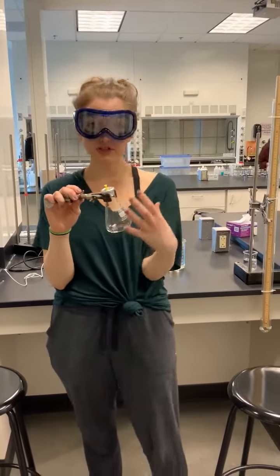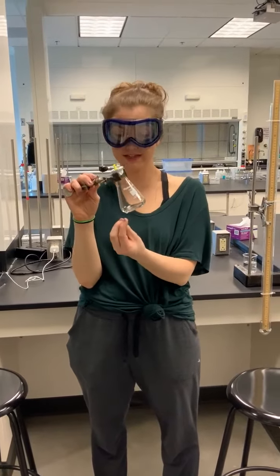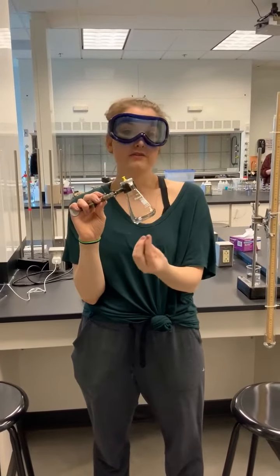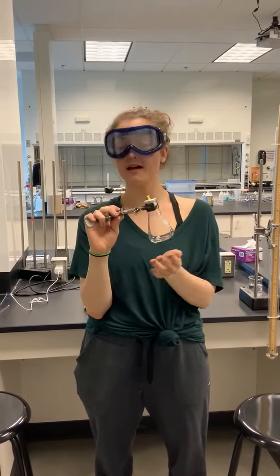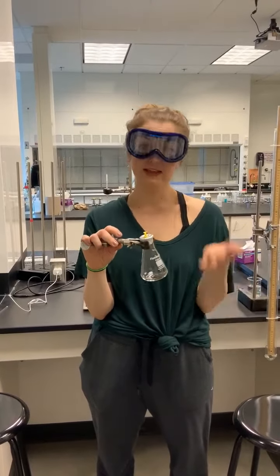We wait for it to cool and it will re-condense at the bottom. You will lose some of your volatile liquid with this experiment — it will come out the top — but we know that it never really operates perfectly in lab.